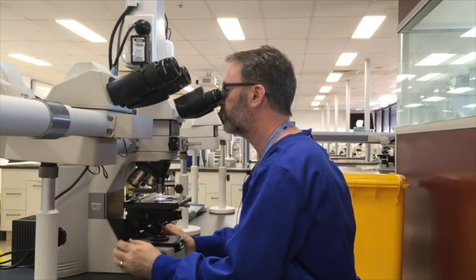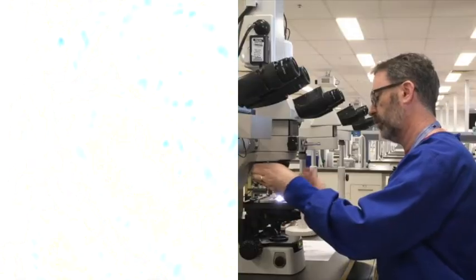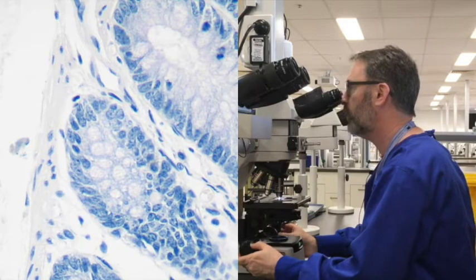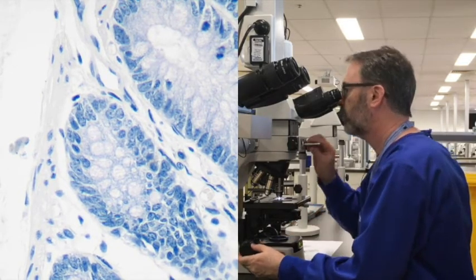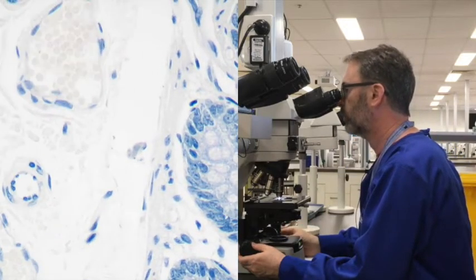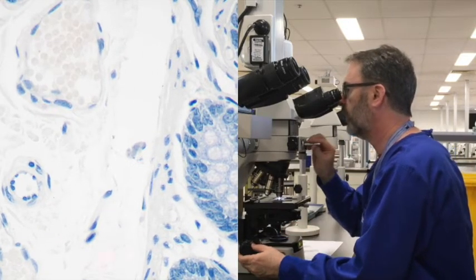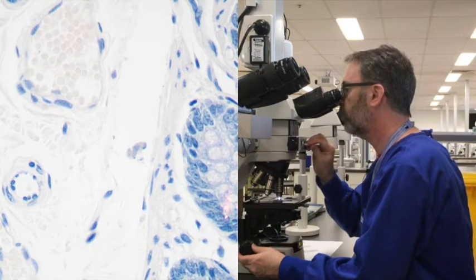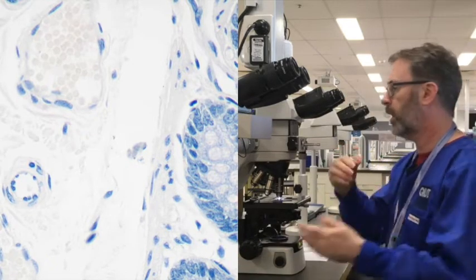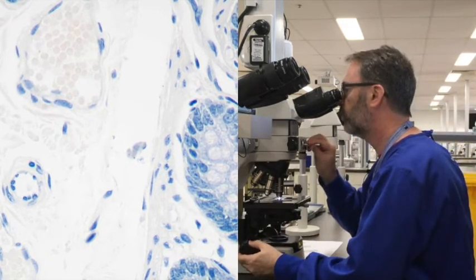So going back to a similar area as to what we just saw, around about this location, go back to the 40x power again. You can see now this time, with the differentiation, there's certainly a dramatic reduction in the overall amount of staining on the slide. If we look within the mucosa, for example, now those goblet cells have just got a hint of blue, so they're not overpowering. They're certainly not blue to the same extent as the nuclei.